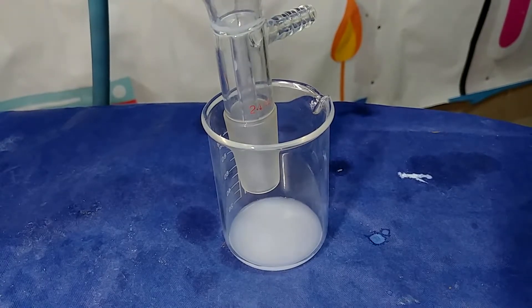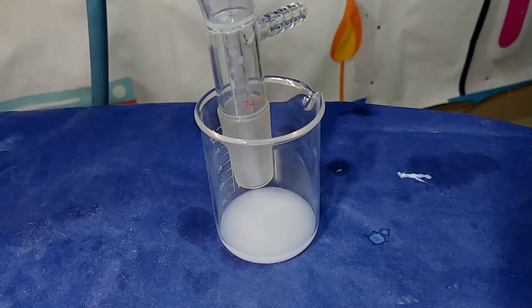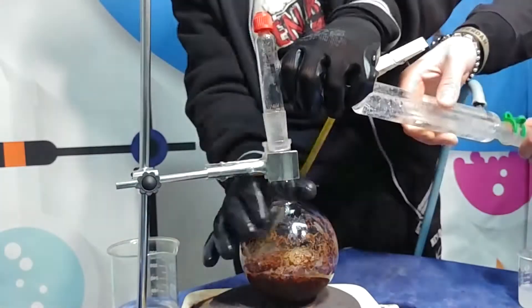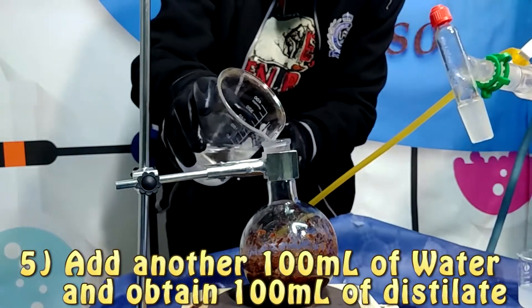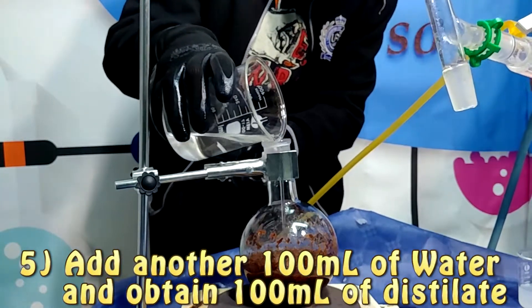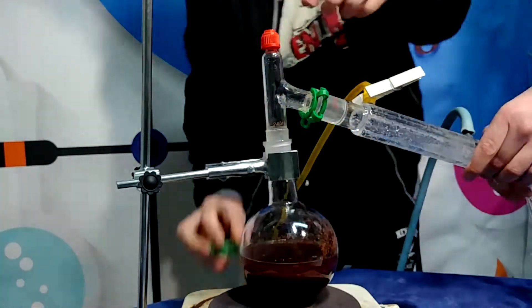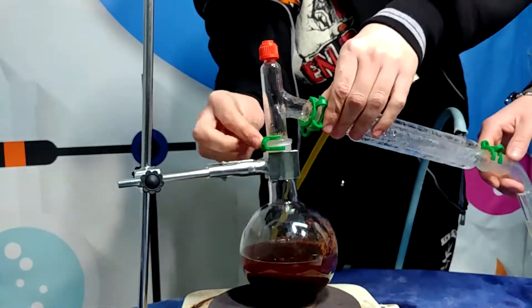That's because when we proceed with our distillation more and more water is produced instead of our essential oil and that's why our solution becomes much clearer because the oil inside is much less than before.